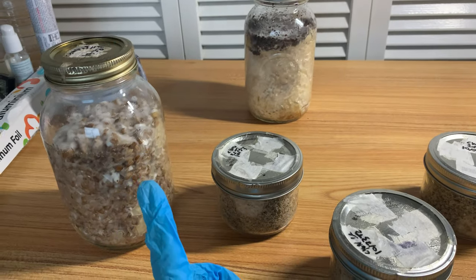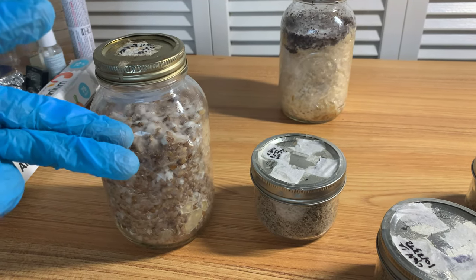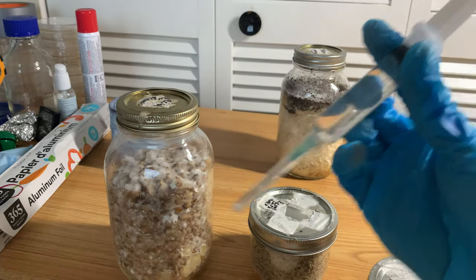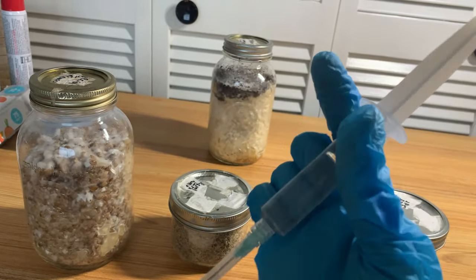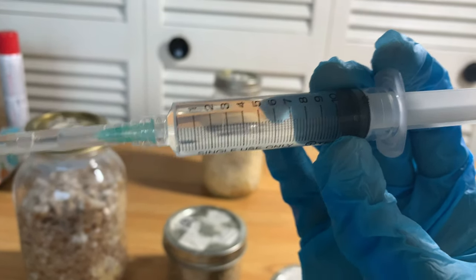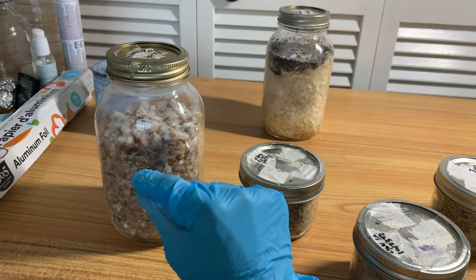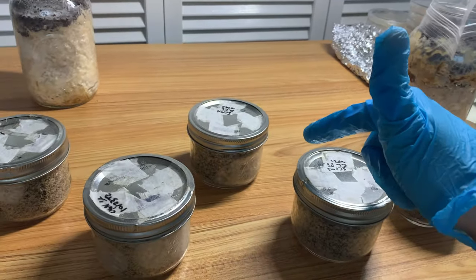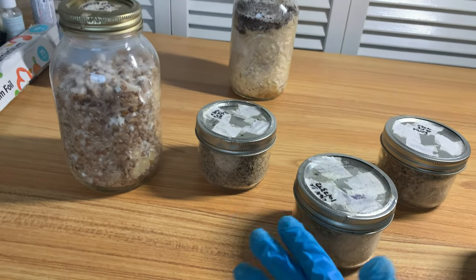My personal interest was: could I take that chunky liquid and somehow put it inside a syringe like this? Could I put it inside a syringe? Because obviously the needle tip is very narrow, so you can't really get any bits - except some really small ones. When I looked at it, I could barely see anything, but I could see there was some movement - clearly it wasn't just water. My test was: would there be enough small mycelium filaments in the water that if I inoculated PF cakes and used that instead of a spore syringe, would it actually colonize? That was my test.